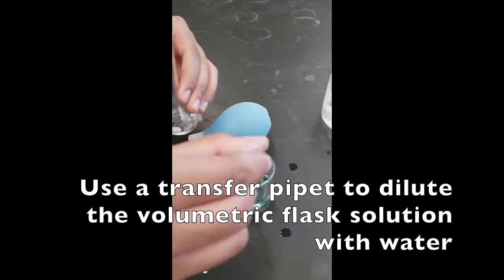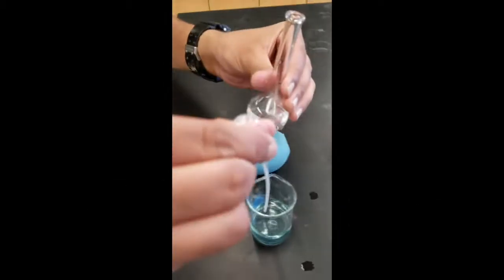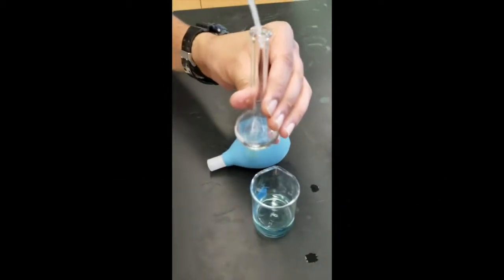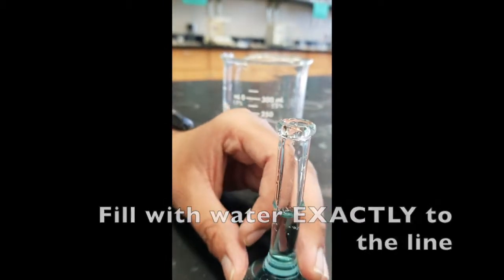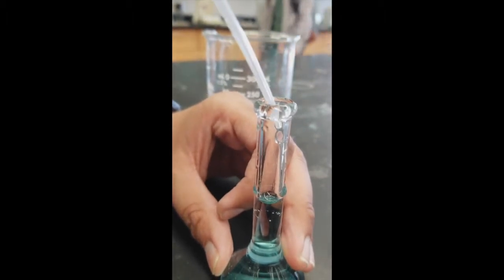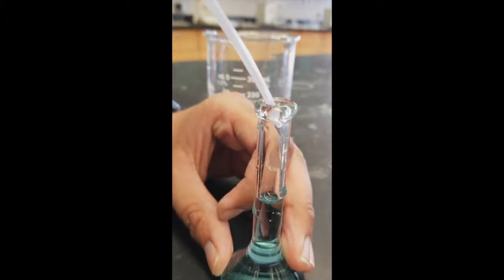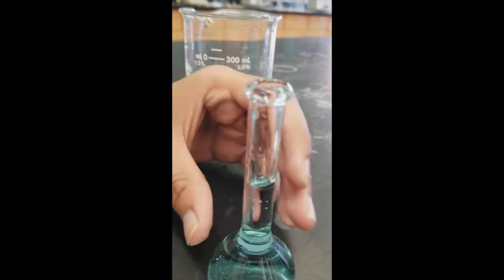And I will use a transfer pipette for that. And as you can see, it is a bit short, so just add a bit more. So it is, the meniscus is at the line, so we have exactly 25 milliliters. So our dilution is done.